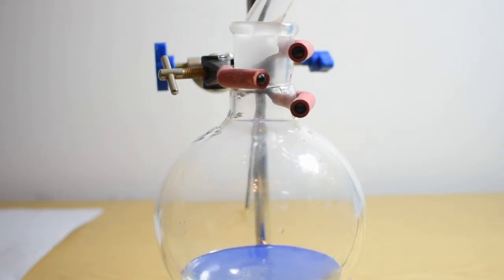Now once that's added the reaction should begin and it might even heat up a little bit, but it's going to be progressing very slowly. So to speed up the esterification reaction I'm going to put the solution under reflux, so to do that I'm going to have to set up my condenser.